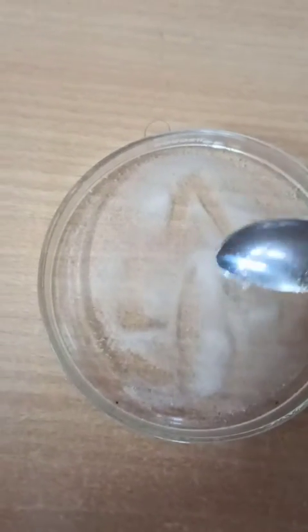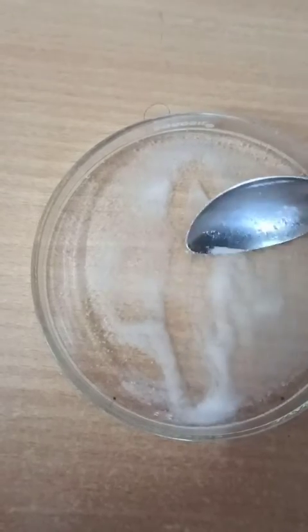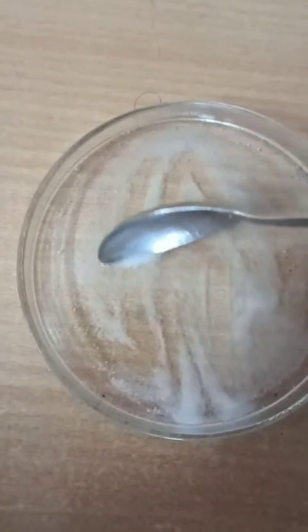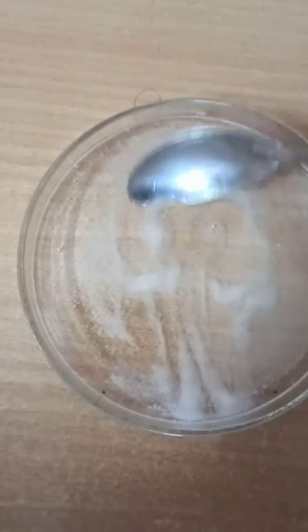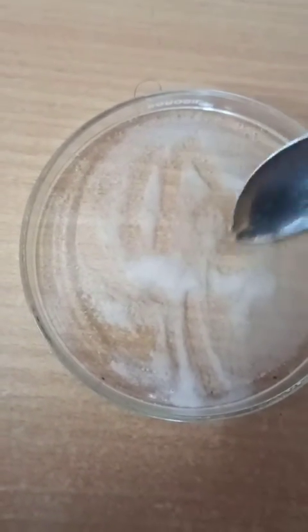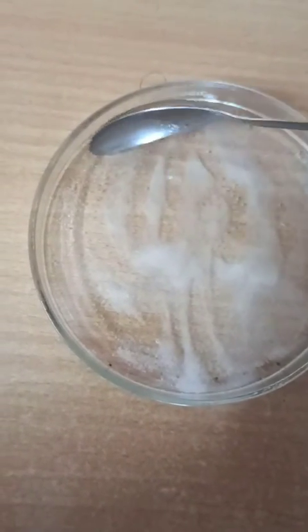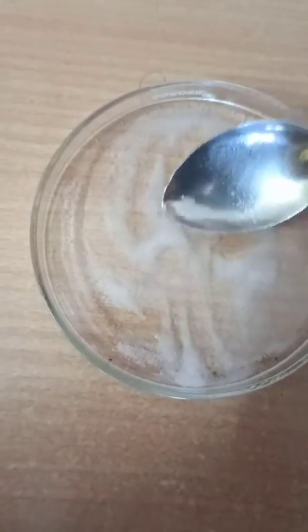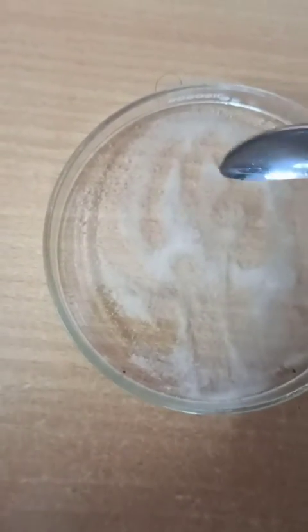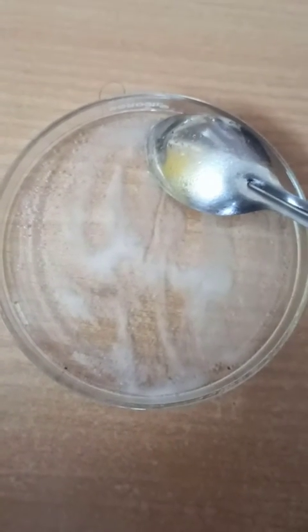Now you can easily see that salt has settled down at the bottom of this petri dish, water has separated from the salt, and carbon dioxide has already evolved. This is an example and activity of a neutralization reaction.